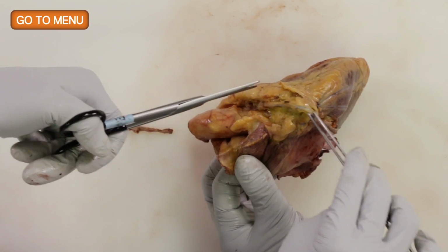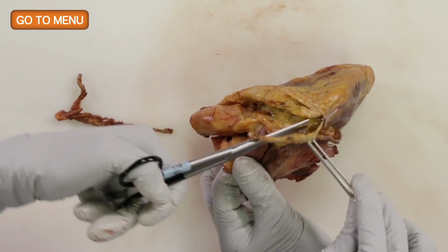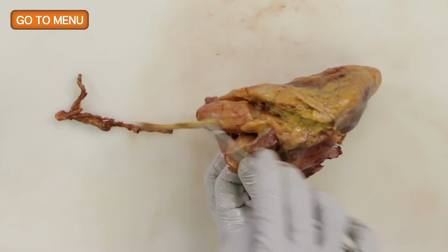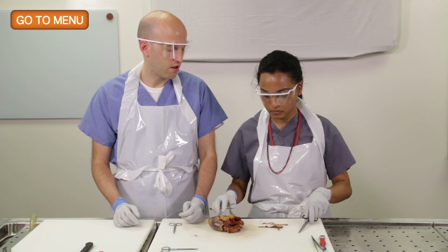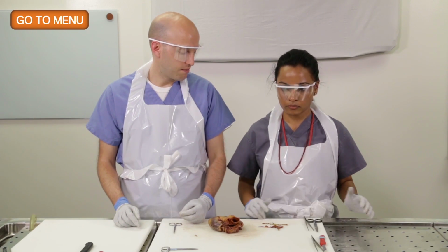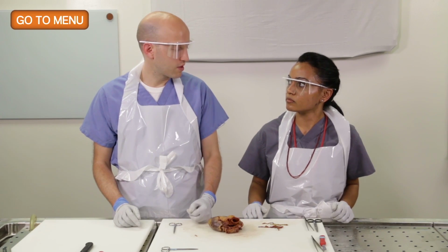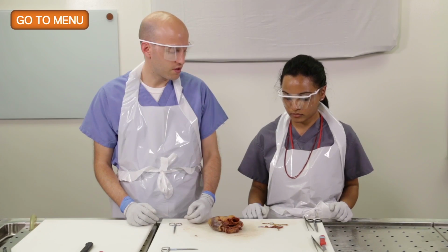Now, if these are heavily calcified in a case of coronary artery disease, we'd want to put them in decal, right? And save them potentially overnight in decalcification and then cut them the next day. We can't submit them if they're calcified for histology, or they'll shatter. We won't be able to see how much stenosis there is.